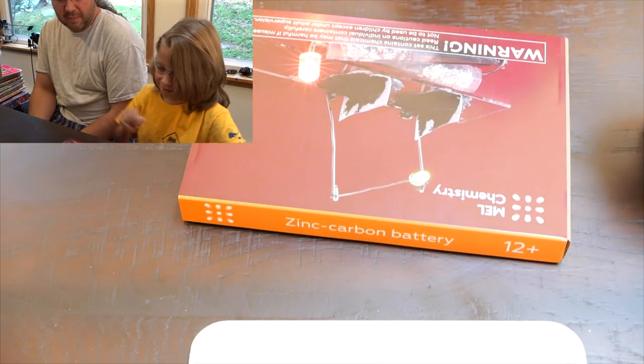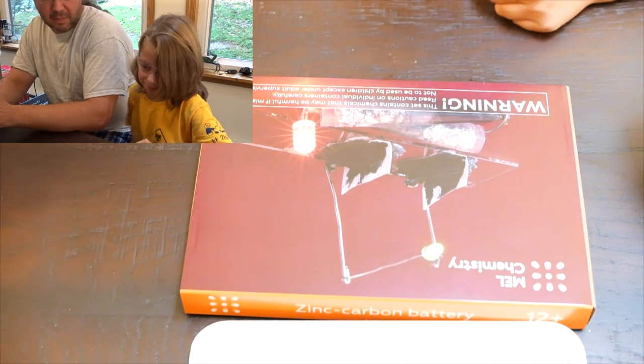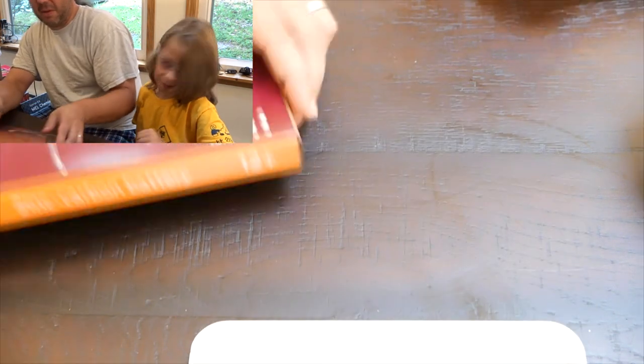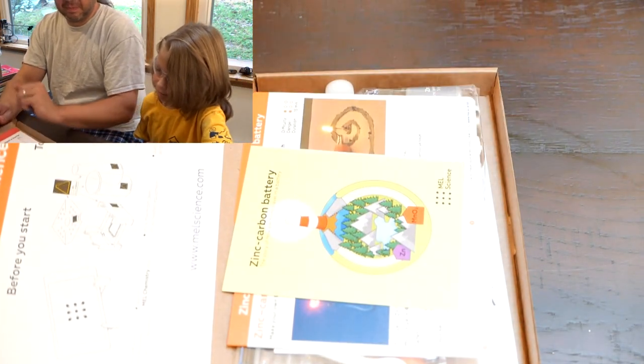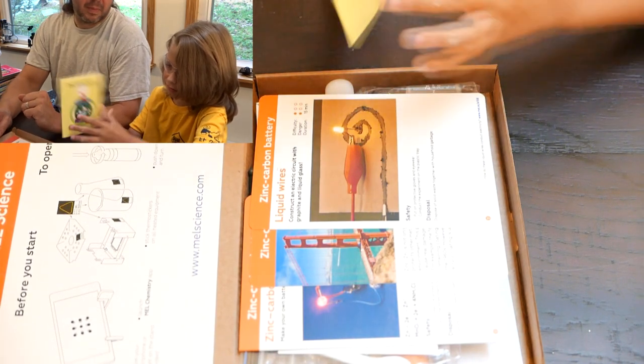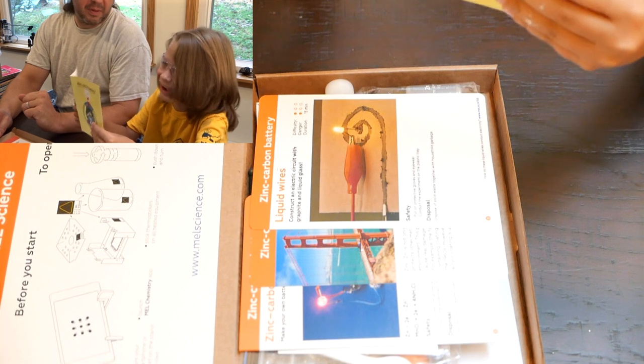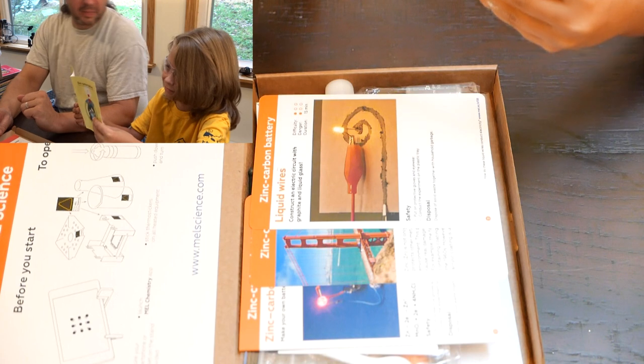Zinc carbon batteries. You can go off to the side now. Thank you, Mr. Sheep. Leave this off to the side. Read the cards. Here's what we got. Wait, what? It says nothing. That's a little cartoon.